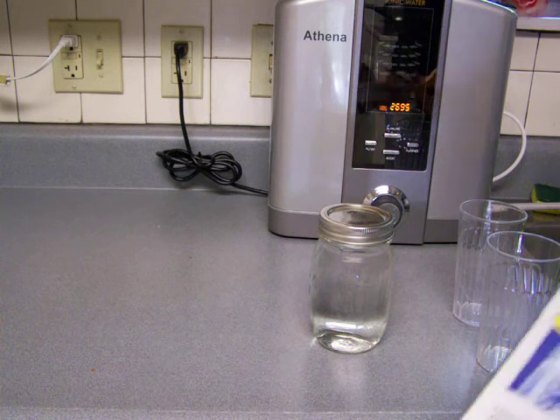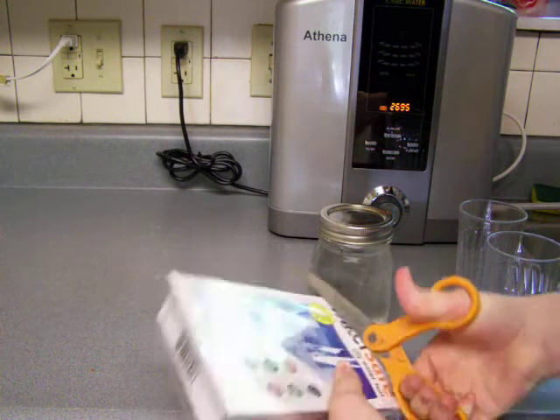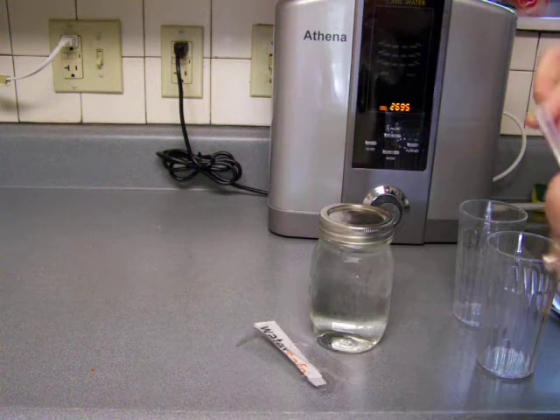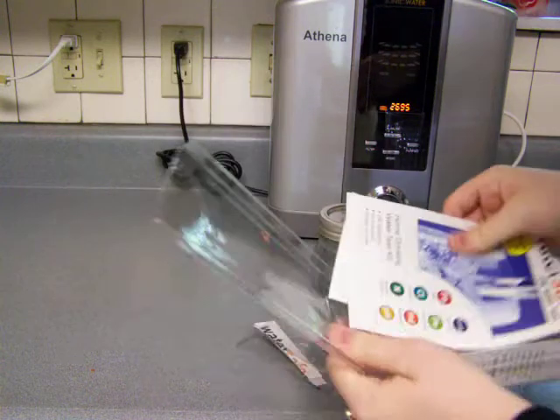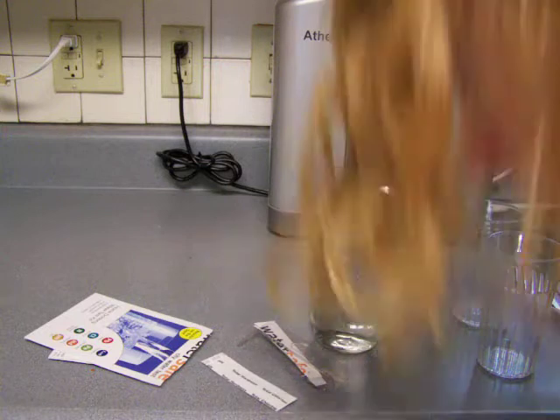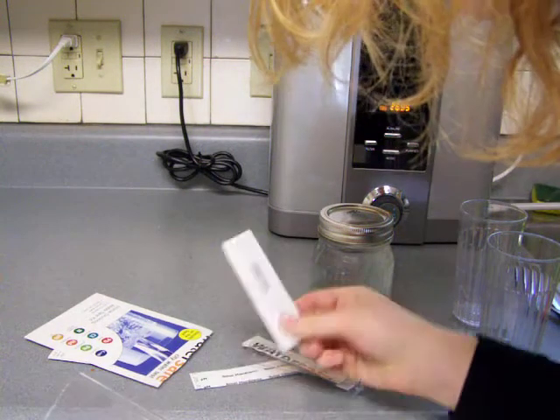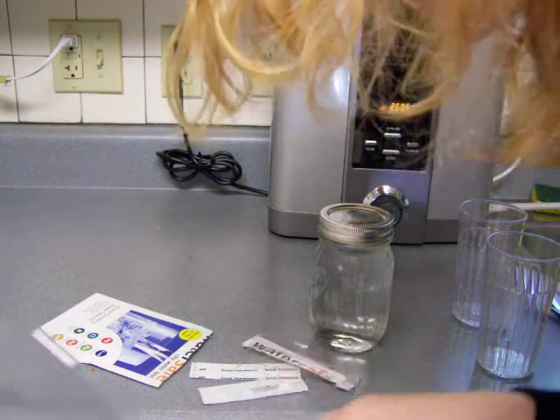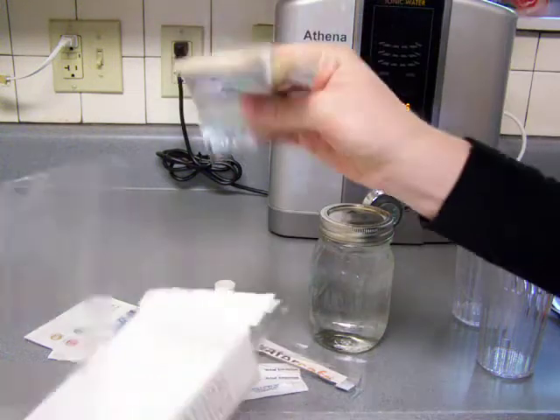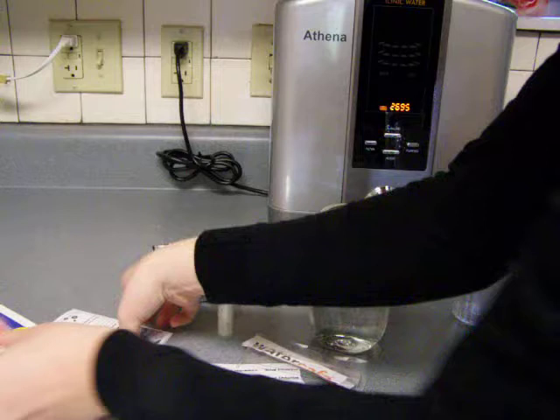So I'm just going to open this. I dropped stuff. Total hardness. Okay, so there's two directions in here.